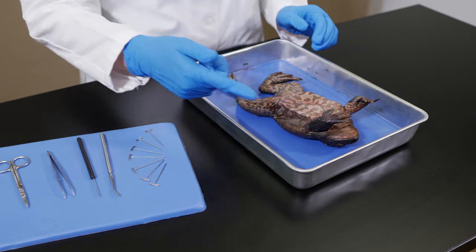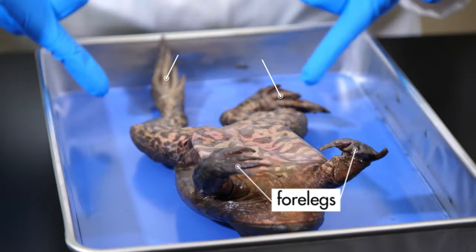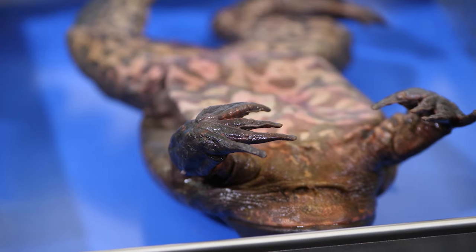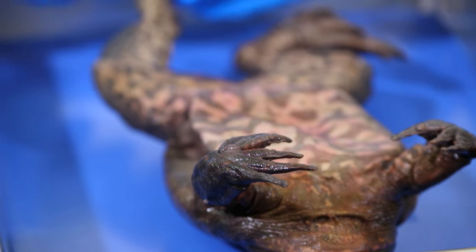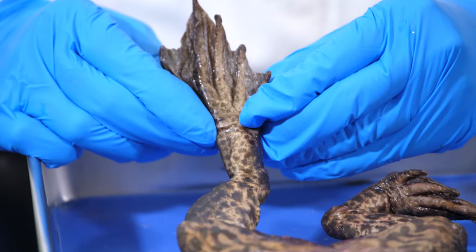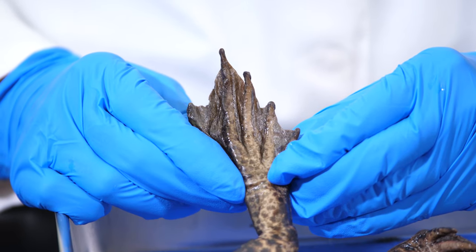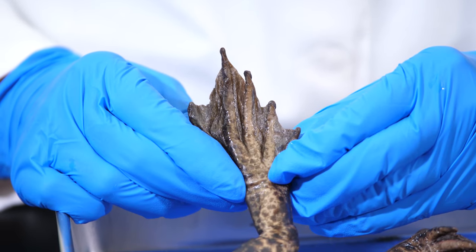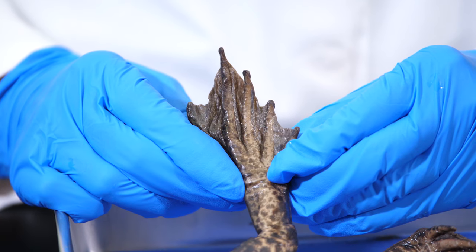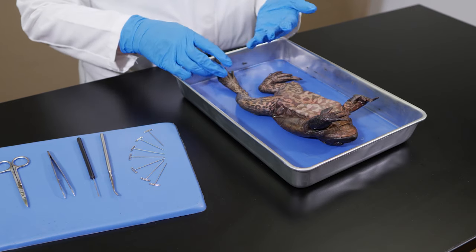A frog has four appendages: two forelegs and two hind legs. There are four toes on each of its forelegs and five toes on each of its hind legs. Notice the webbing between the toes — this webbing helps the frog swim in the water. Its longer hind legs help it jump on land.